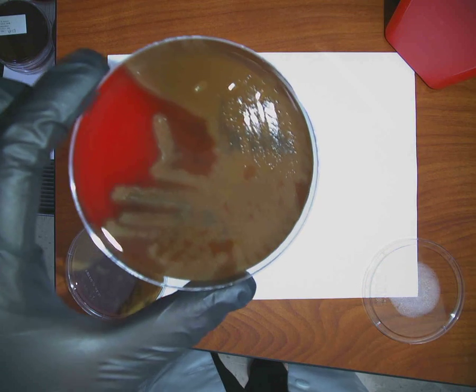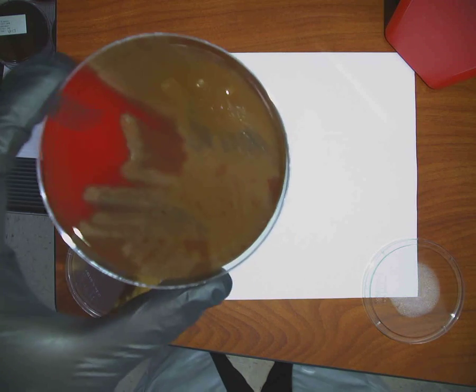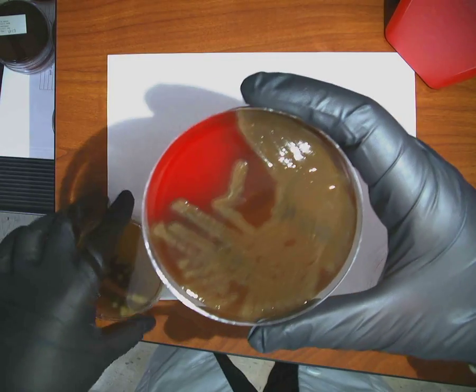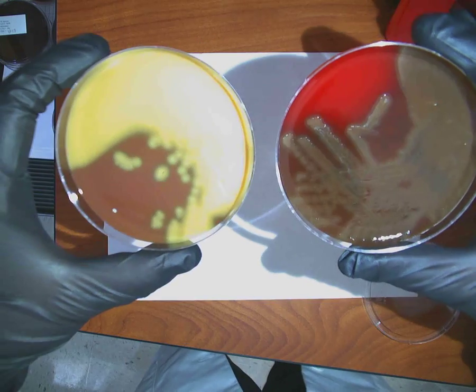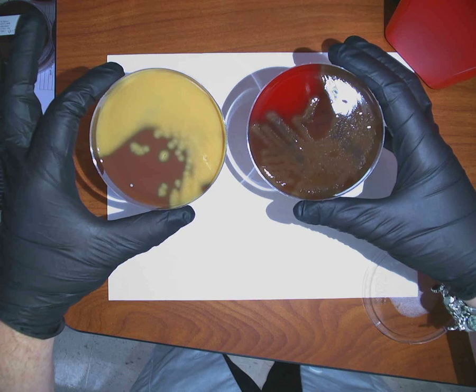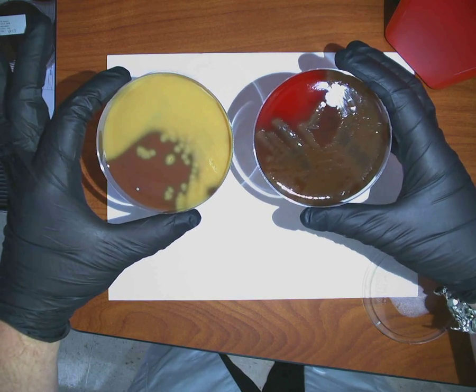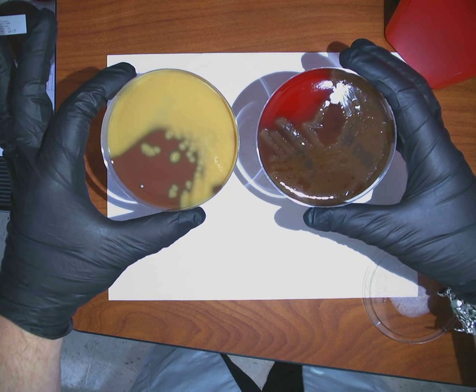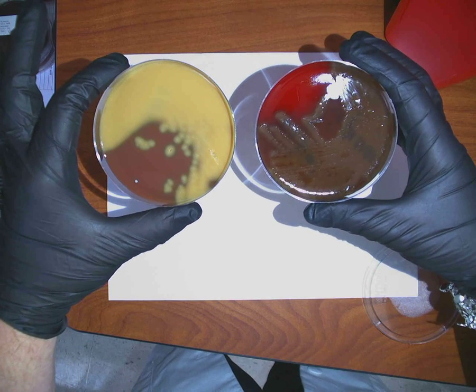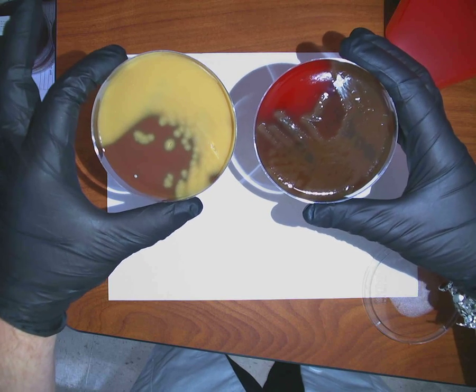I heard it's not staph. I heard it's not Streptococcus pyogenes. Why is it not Streptococcus pyogenes? Yeah. It's not beta hemolytic. Okay? So we're going to compare these two right here. What else do I know that it's not based on the color of the colony? It's not Neisseria. It's not tan. So you can rule out Neisseria, Moraxella, and Haemophilus.